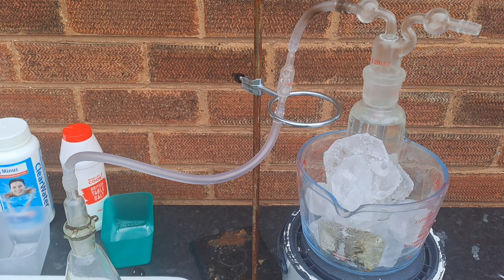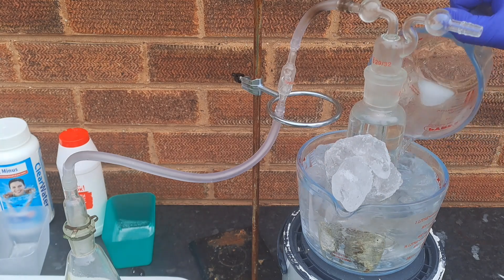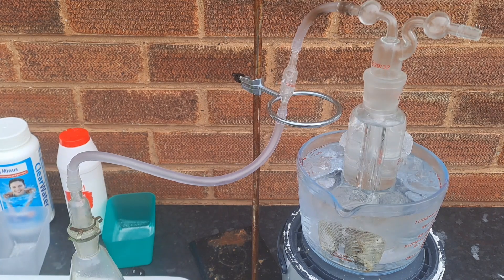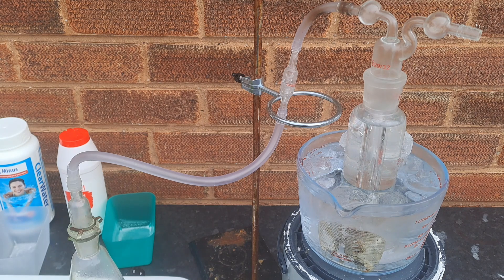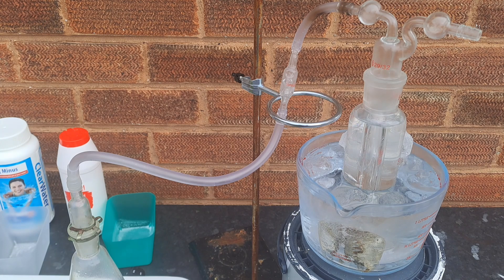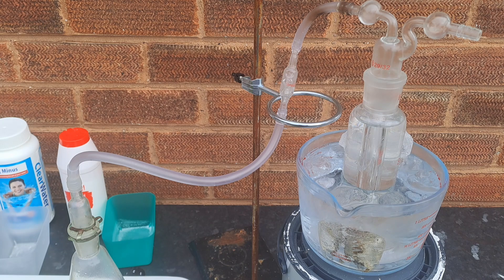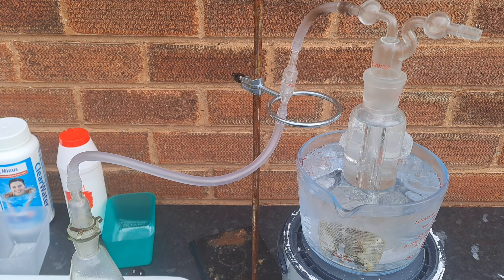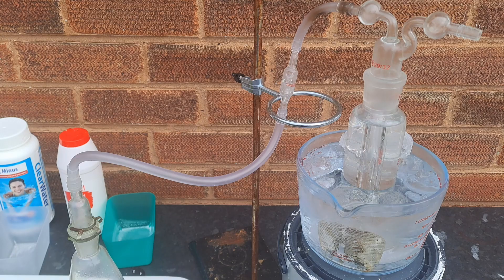Once heat is applied, the sodium bisulfate will react with the sodium chloride to generate HCl gas through a chemical reaction where the hydrogen ion from the bisulfate exchanges with the sodium ion from the chloride, essentially creating hydrochloric acid, which then readily releases HCl gas. The bubbles you can see at the moment are just air bubbles — air is being expelled from the flask before the HCl gas gets pushed over. You will be able to tell when hydrogen chloride is being generated, as the bubbles will almost completely dissolve in the water. The reaction is going to take a couple of hours to complete.